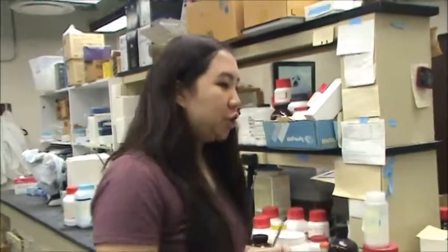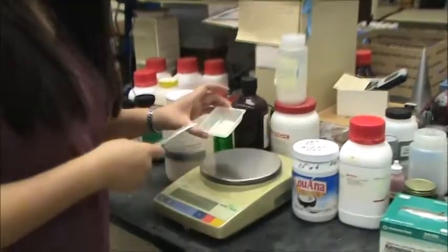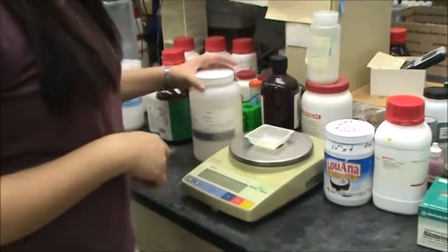Alright, so the first step is to measure all the ingredients that you need for the food. So here we have agar that we've already measured out using the balance beam and it's right here.